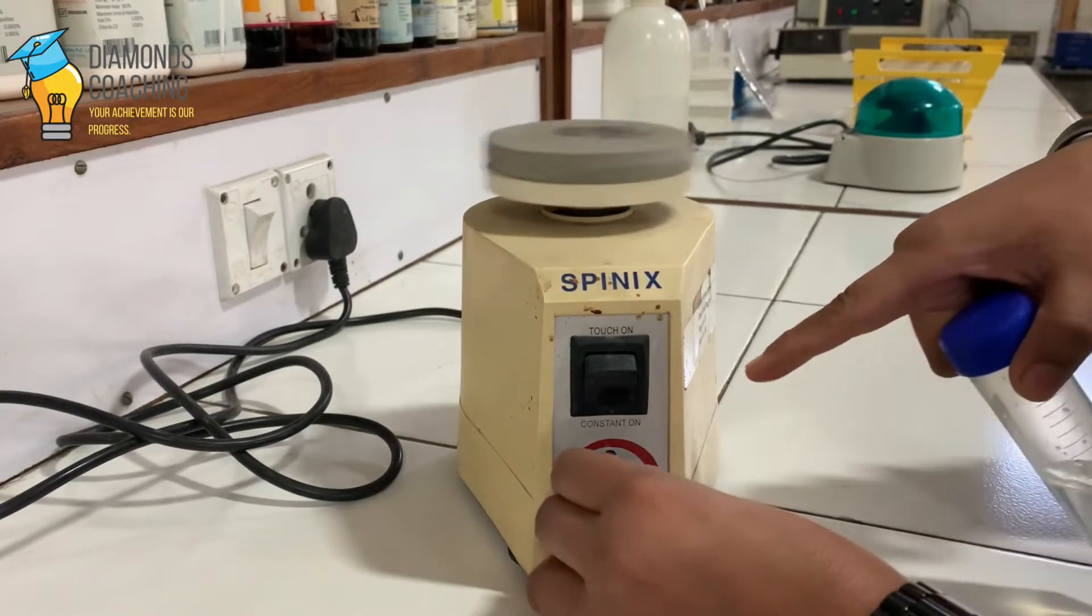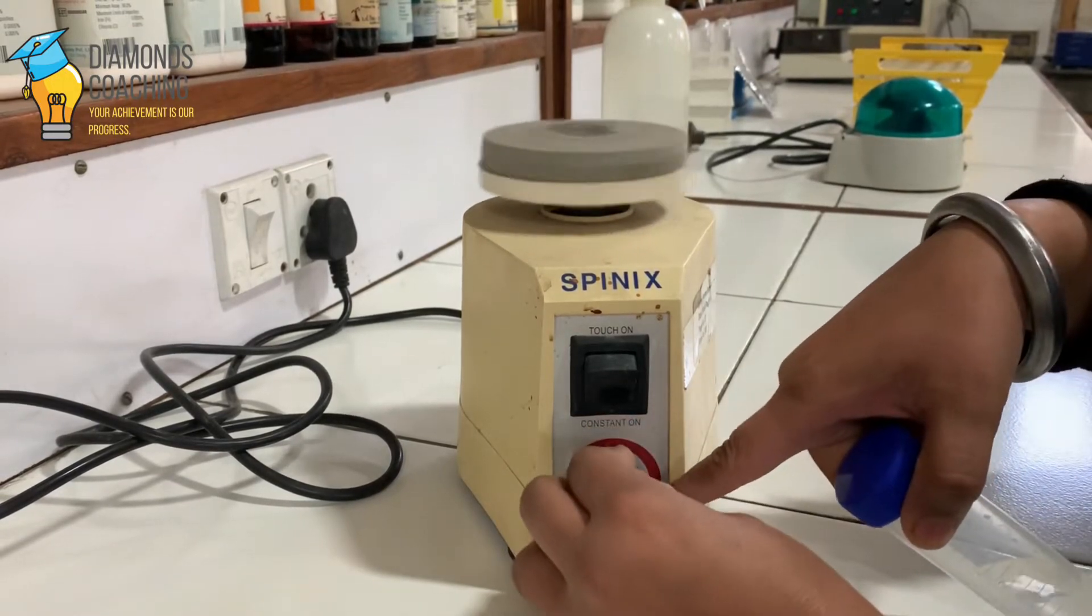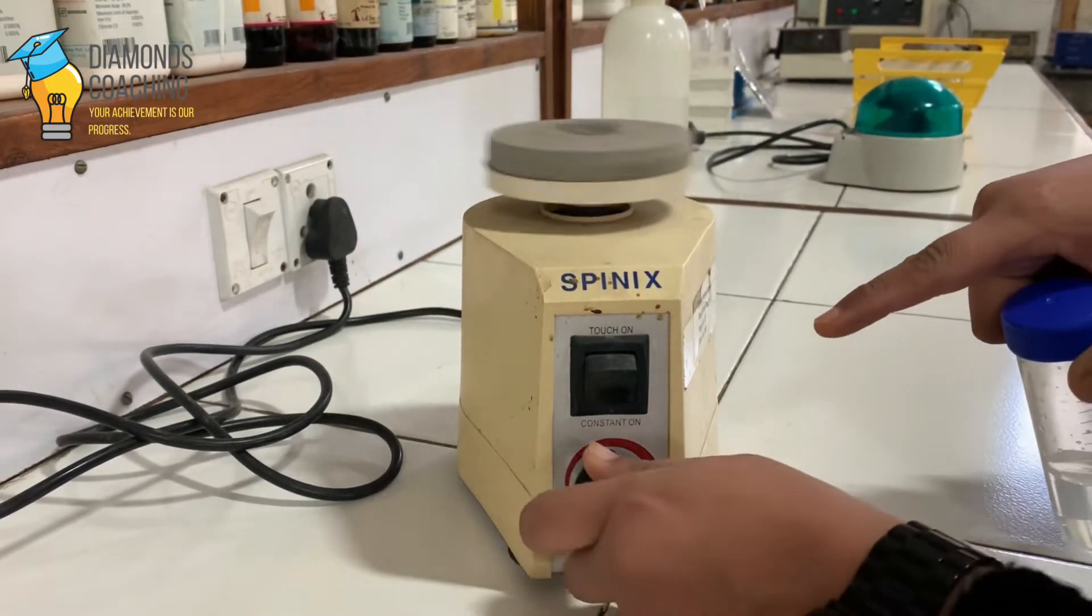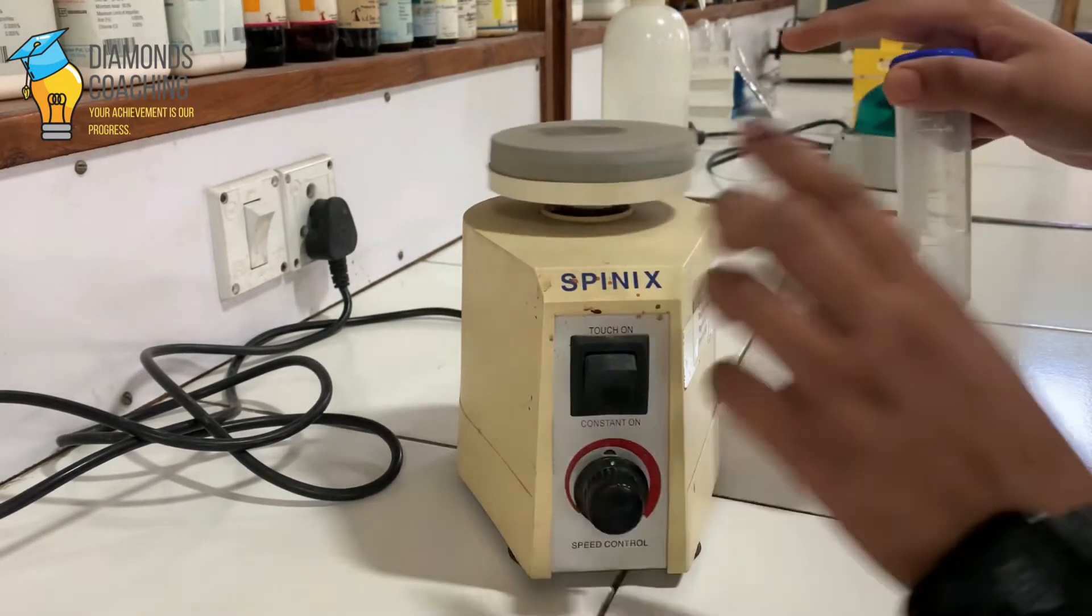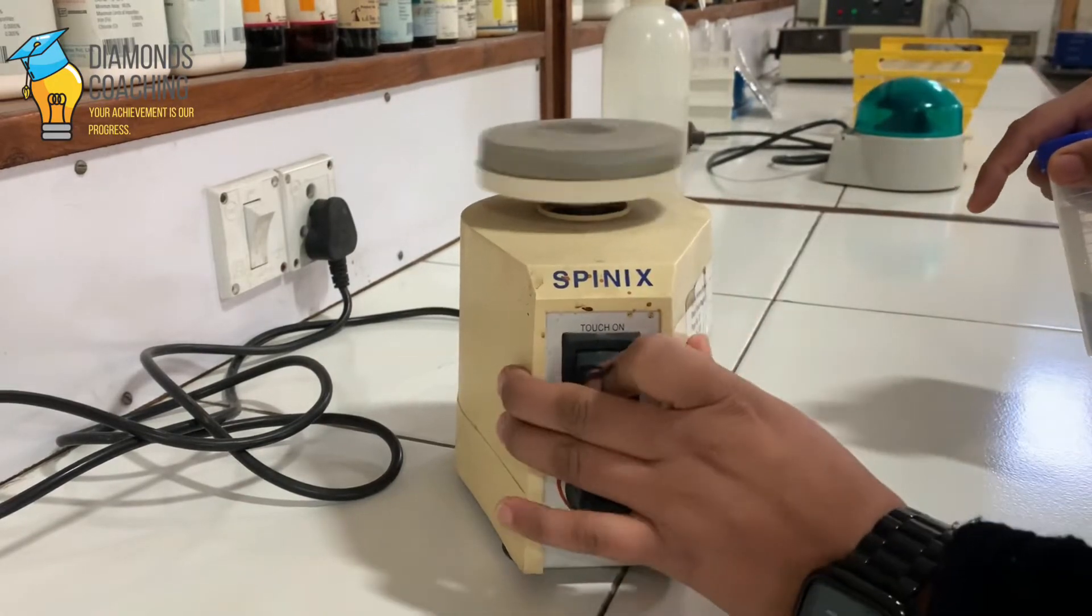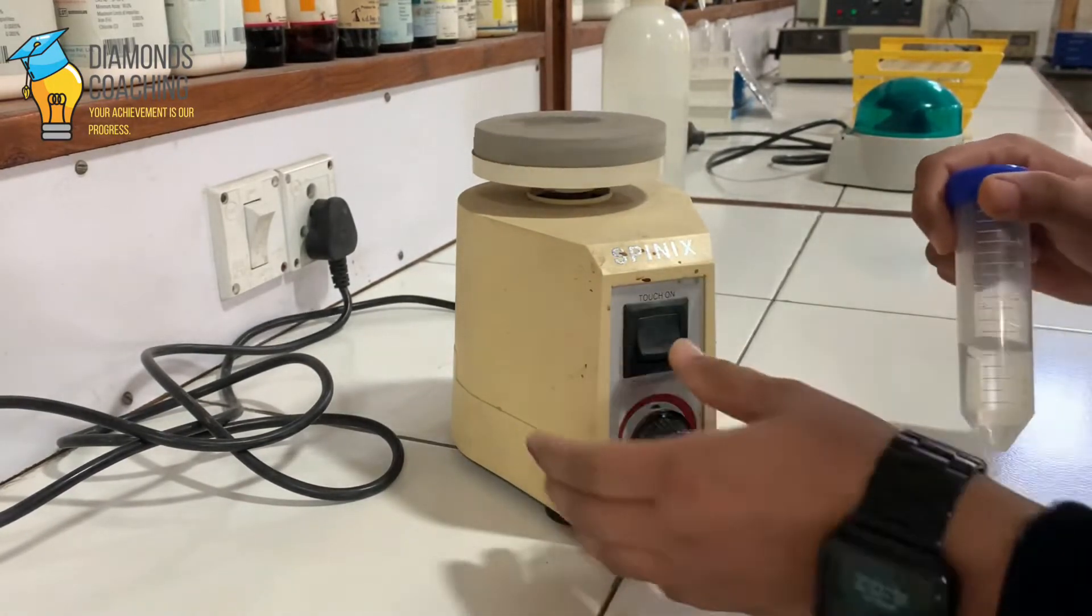We are controlling the speed. This is the highest speed and this is the lowest speed. So this is how it works. Its application is in laboratories.